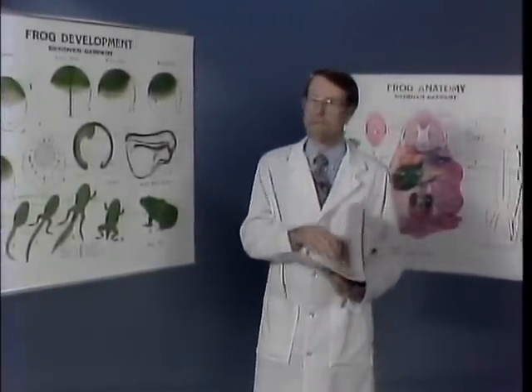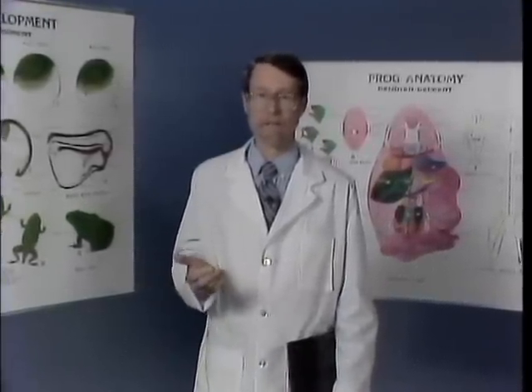The demonstration which follows is designed to aid your understanding of the vertebrate body, whether you're planning to do a dissection or simply wish to use it for review. In either case, it will help you to appreciate vertebrate structure, function, and some of the special adaptations of the amphibian life forms around you. All zoologists rely on special terms which help describe or locate a particular feature with respect to others. Terms used during the course of this exercise adhere to formal conventions as they apply to amphibians.